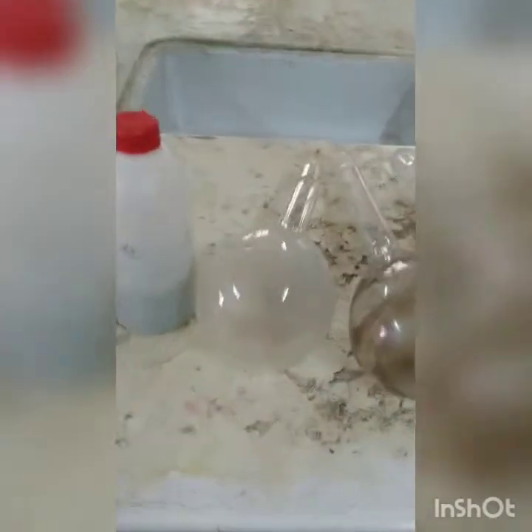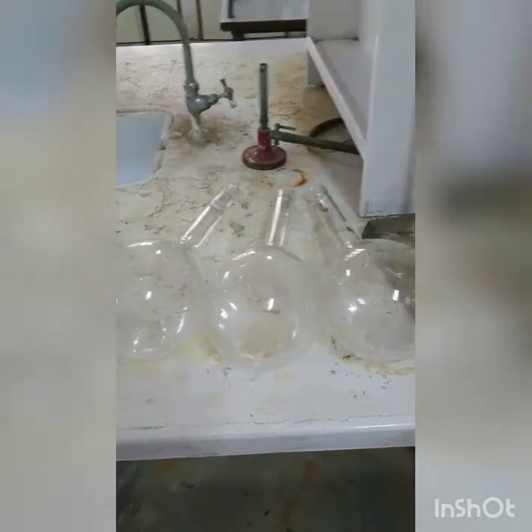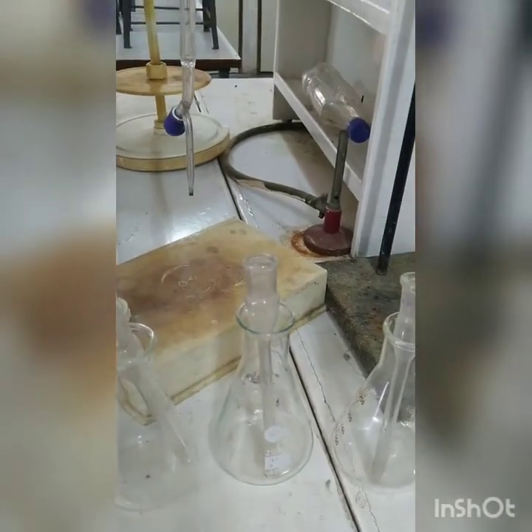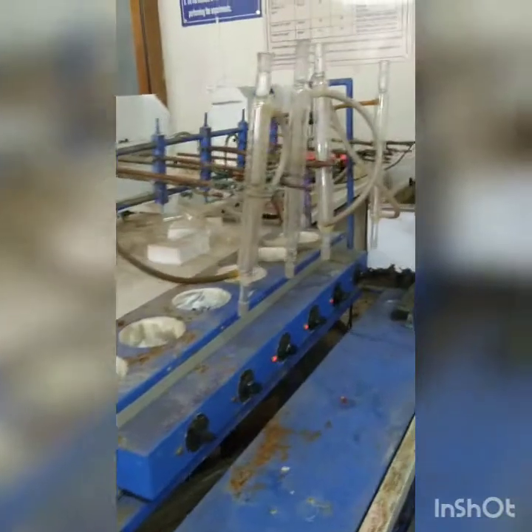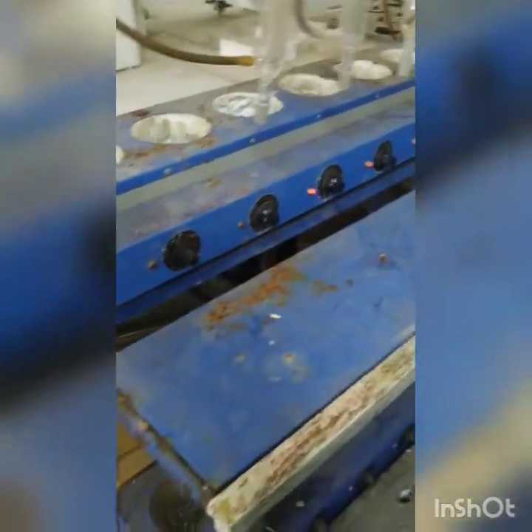we have other accessories, the glass beads, then this is the glassware. The first 3 flasks they are used for digestion, and the next 3 they are used for distillation. And then we have conical flask with special type of stopper arrangement that we will be using during distillation again. And this is our total Kjeldahl nitrogen accessories, and this is our total Kjeldahl nitrogen distillation columns. So we will be using these distillation columns, this entire equipment assembly during the further procedure.